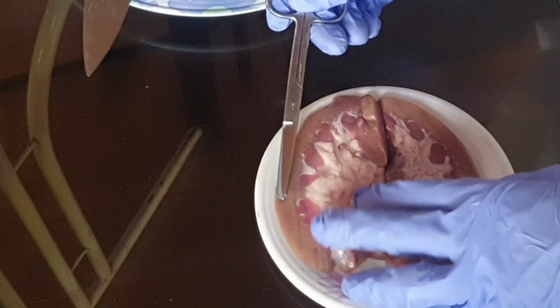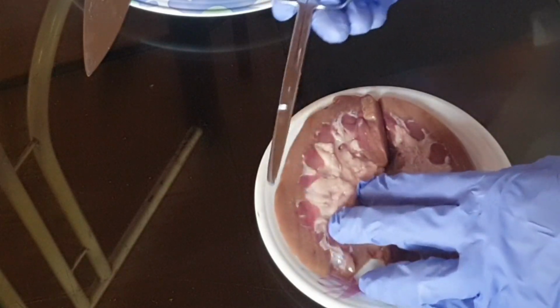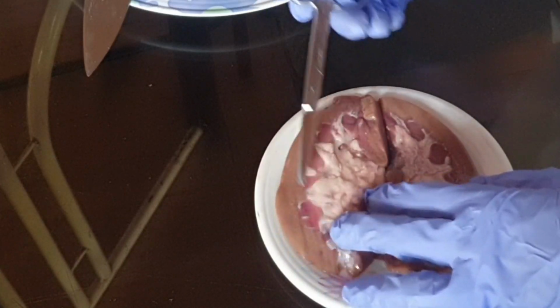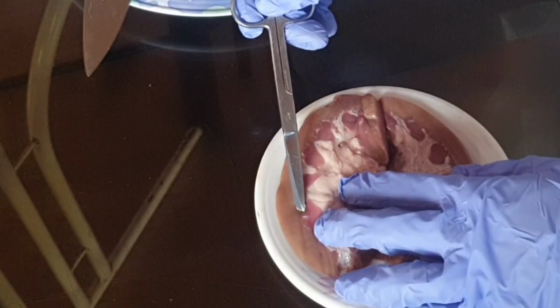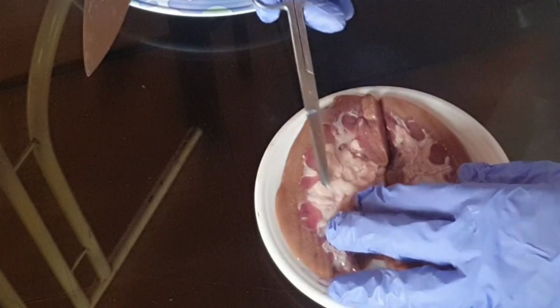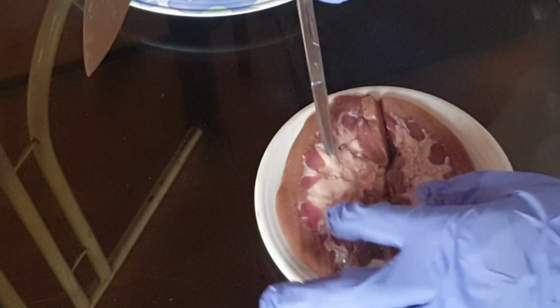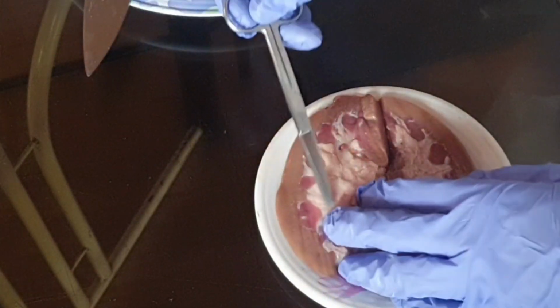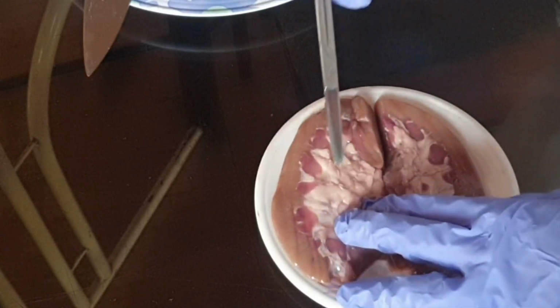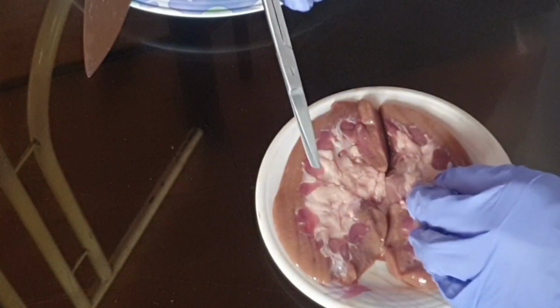Then it goes to the DCT, or the distal convoluted tubule, meaning away, and then the urine goes to the collecting duct, where many nephrons are connected through one common collecting duct. So urine from the collecting duct goes to the renal pyramid, then down into the calyces, where it's like a canal that goes down to here and outwards. It goes to the calyces, and then into the renal pelvis. Then it goes out from the renal pelvis, down to the ureter.